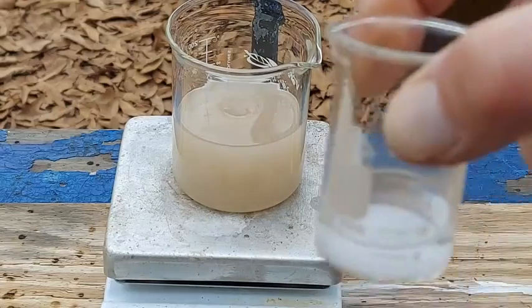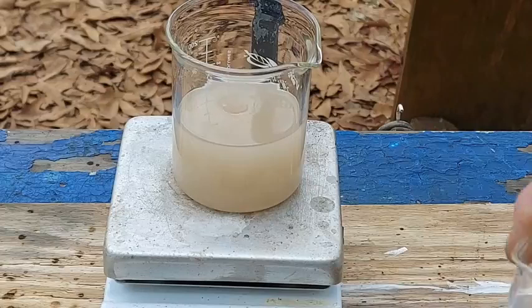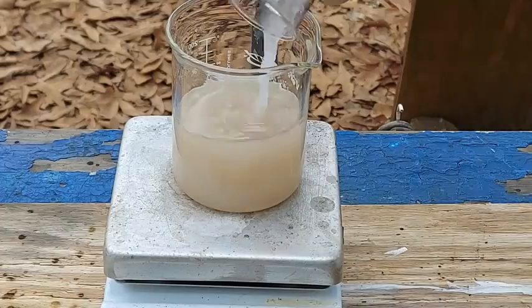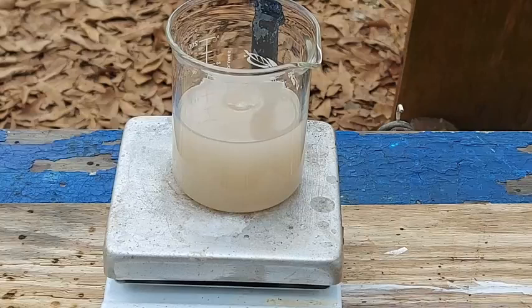So yes, this is what it looks like after it sits for a day. Finally, thallium azide did the very same thing though - I'd swear it looks like it's getting lighter over time. When I posted a picture of it yesterday somebody said it looked like a beaker full of jizz. I mean, they're not totally wrong. Anybody that knows about that horrible story that's gone around the internet - you know the one with the jar.